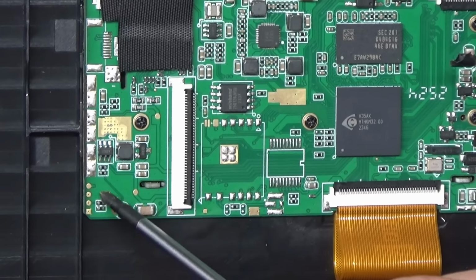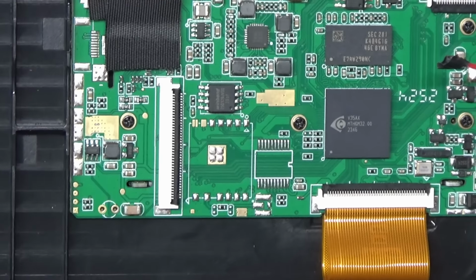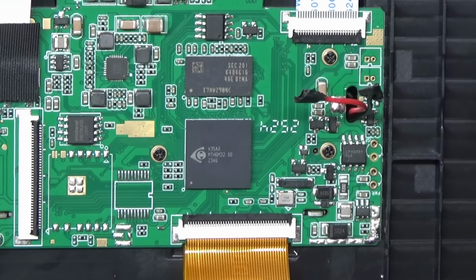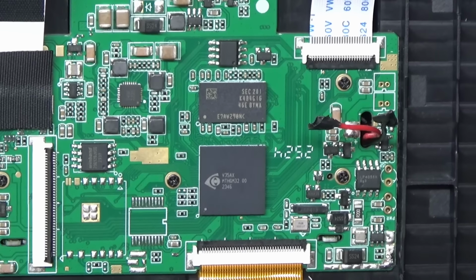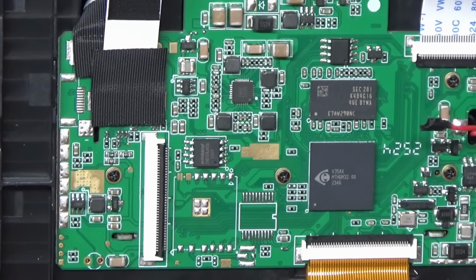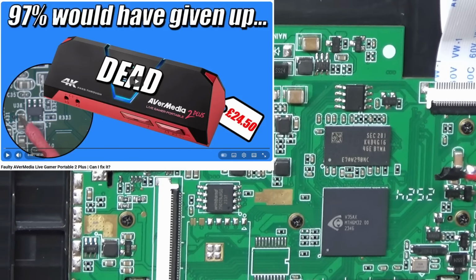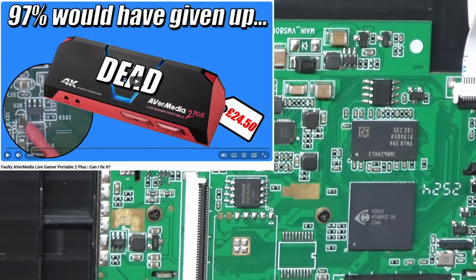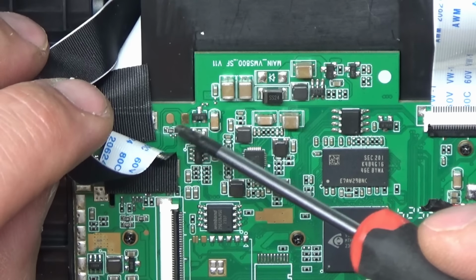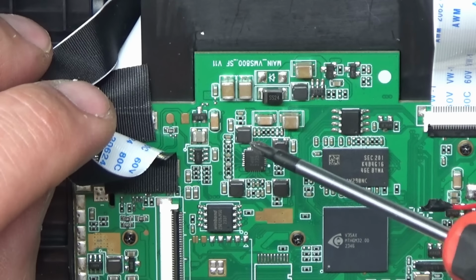I wonder if it's worth hooking something up to here to see if we've got any serial data on there. See if there's any kind of bootloader or something perhaps. And I think the same chip here, or very similar chip, was used in the AV video capture device that I looked at. Actually looks like there's some pads under here. A couple of test pads possibly.